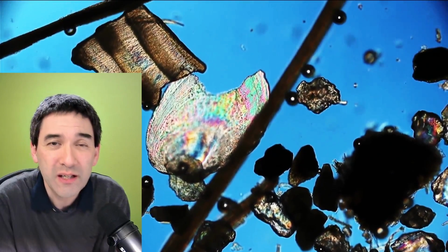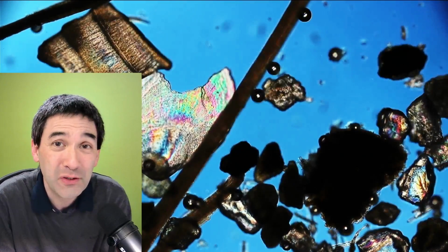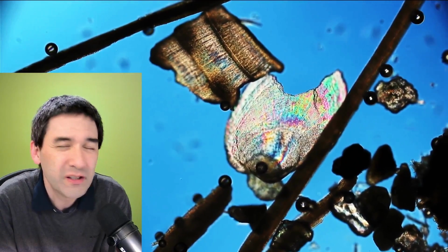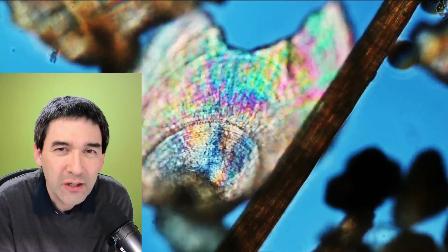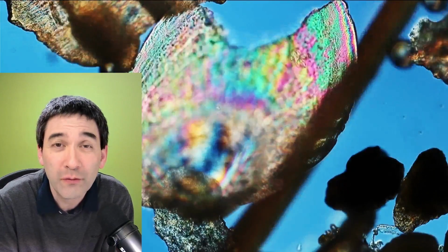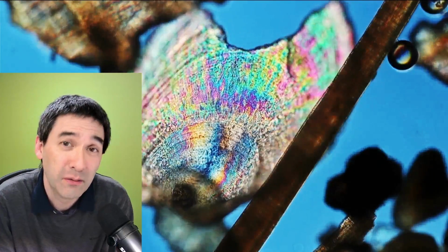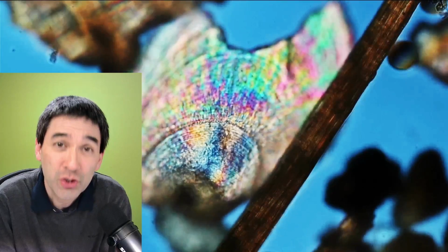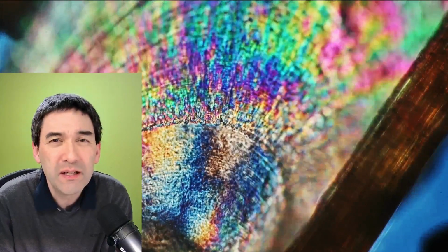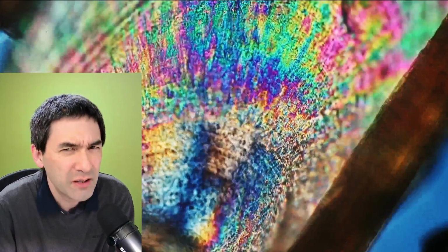And then I found these interesting structures here. Fairly colorful because I'm using polarized light. Very regular looking structures, and they also contain some rings in there. And look, it did remind me a little bit of the shell of a clam, a seashell. This was indeed my first suspicion, but then during my live stream, somebody suggested, well, maybe it could even be the scale of a fish. And I said, actually, that's also a possibility.